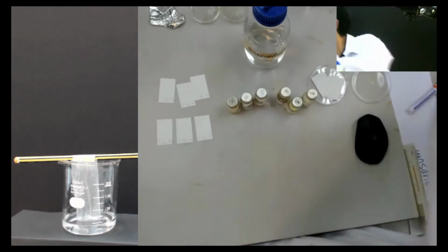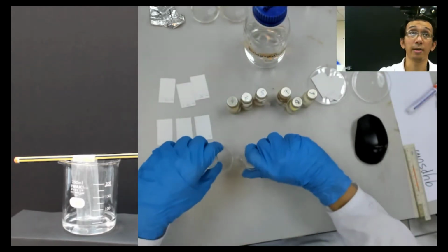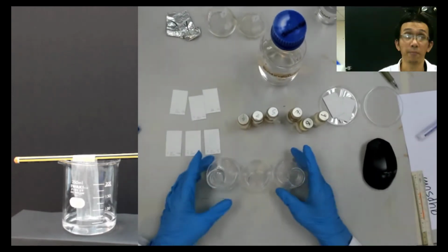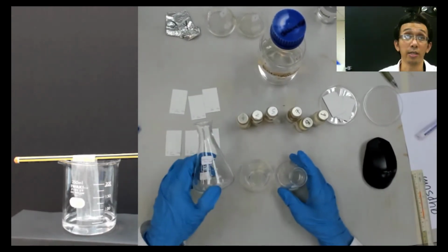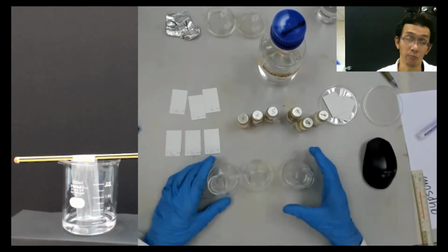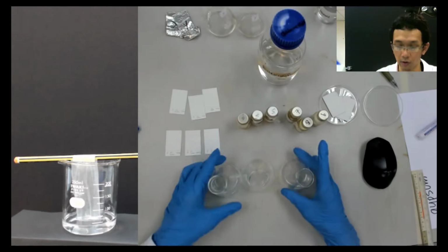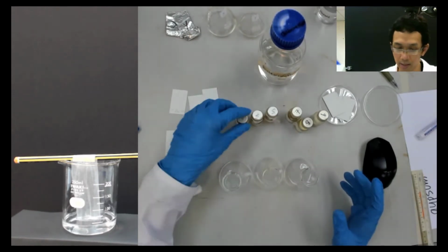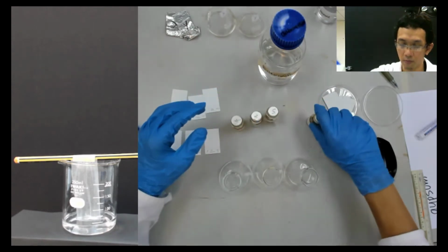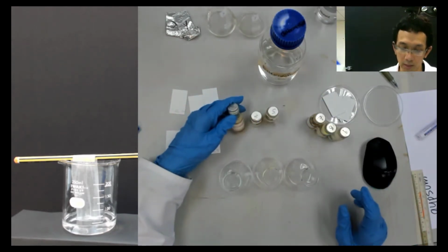So now I have done this. I have prepared the flask, and each flask already has a label on it. It's important to label because everything is colorless later on. So now the same thing. Let's do group 2 first, nitroacetophenone.